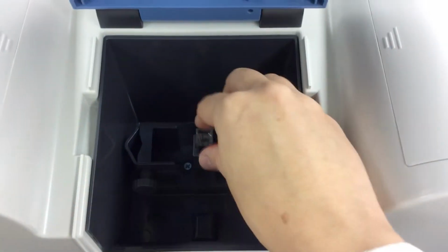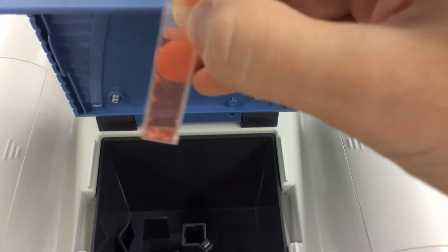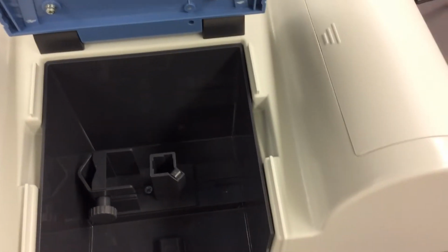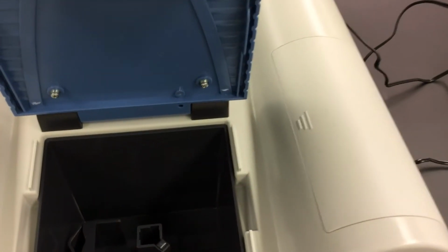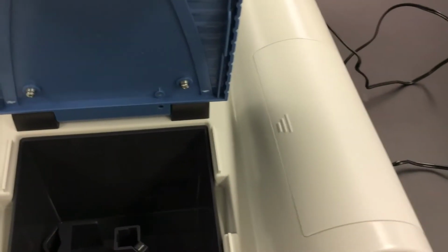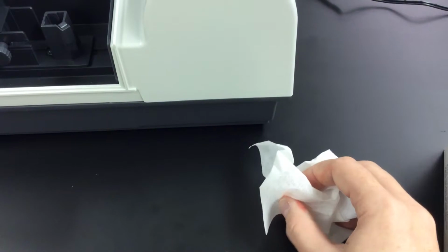So now, when I take my sample, I take my blank out, I put my sample in. Now one of the things you always want to do, look at all those bubbles. Okay, you want to tap the sides to get those bubbles out. Because if you have bubbles in there, those bubbles will mess up your reading. Okay, so you tap the sides, and then you also want to use these little Kim wipes. Wipe down all the fingerprints from the exterior.